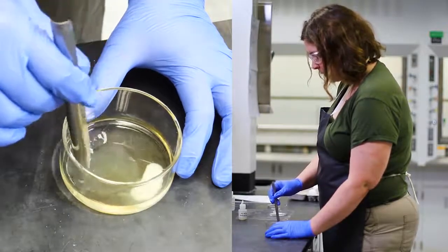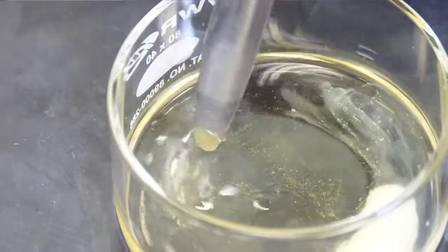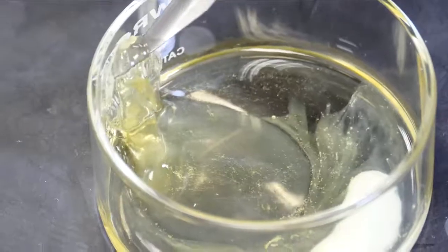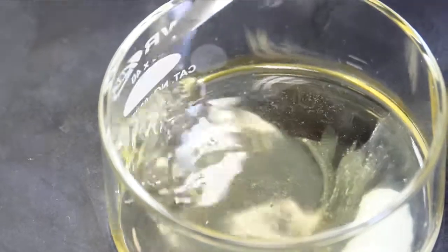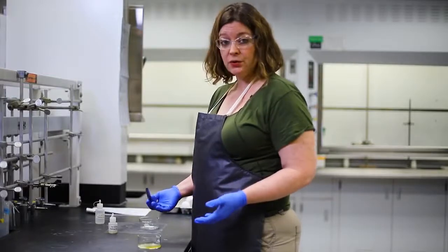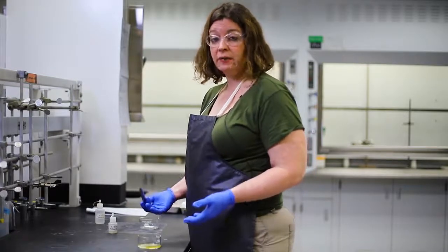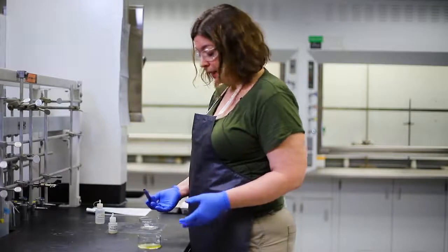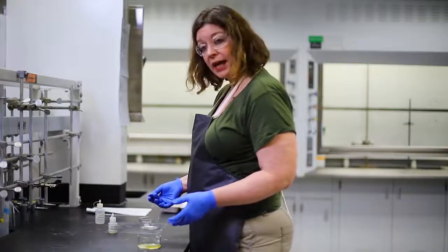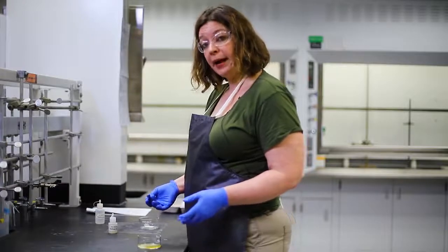It's kind of formed a jelly. In either case, if this was your eye, there's probably no coming back. So wear your safety glasses or goggles whenever you're handling corrosive material. And if you even suspect that you've gotten anything on you, get over to the sink and start flushing right away.